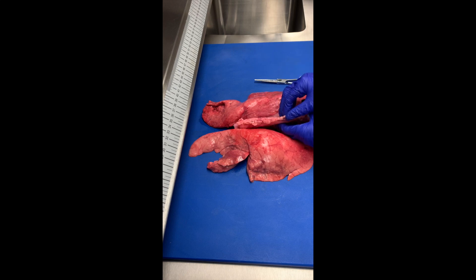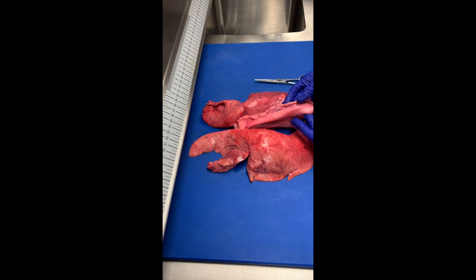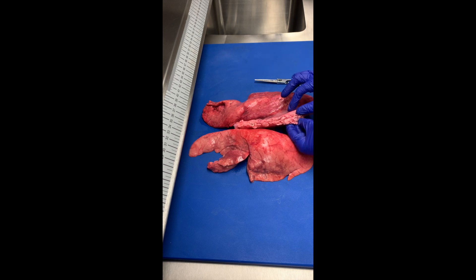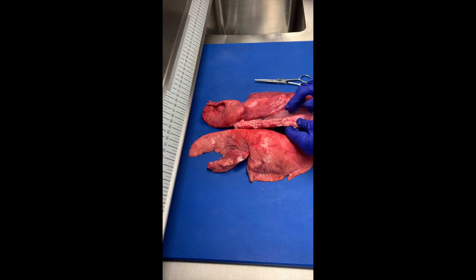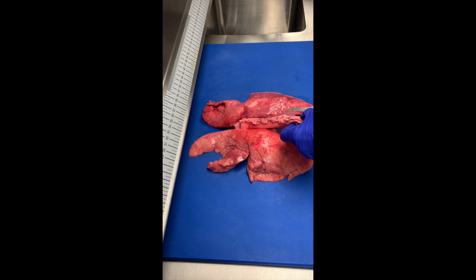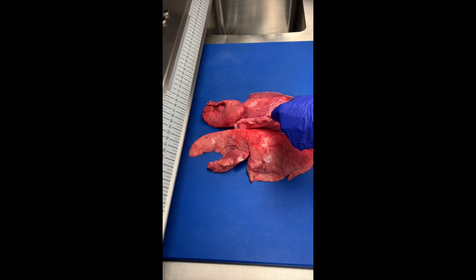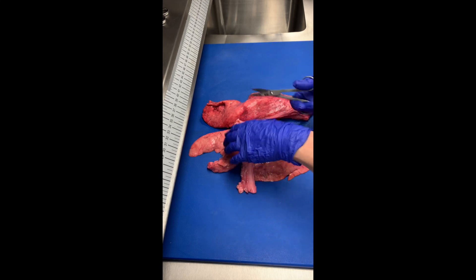First, identify your aorta — it will be a pink tan smooth tubular structure, and attached to the aorta you will find abundant adipose tissue. Within that adipose tissue you'll find multiple lymph nodes. Go ahead and remove the aorta and set that aside in a pre-labeled bag.